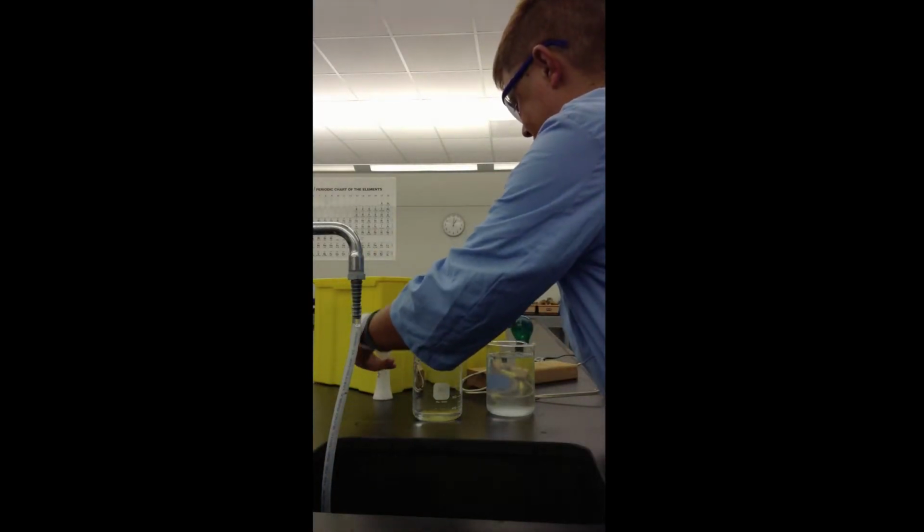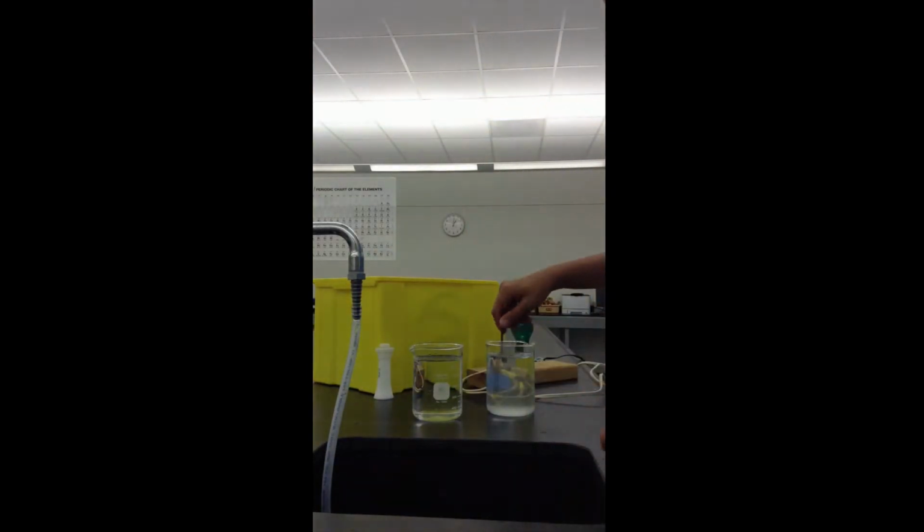So in order to make one of the water samples more conductive, I'm going to add ordinary table salt. When I add table salt to the water, it will produce Na+ sodium ions and Cl- chloride ions. So you have the sodium cations and the chloride anions, and I'm going to give this a little bit of a stir. That's probably good enough. You don't have to dissolve necessarily all of the salt.